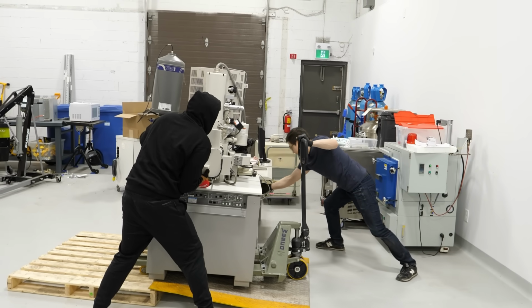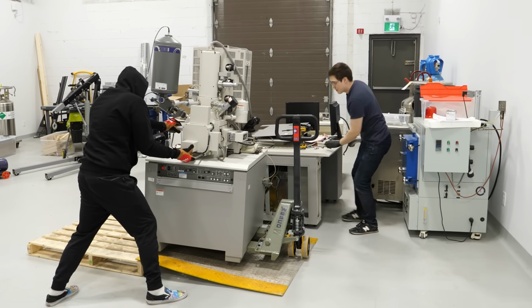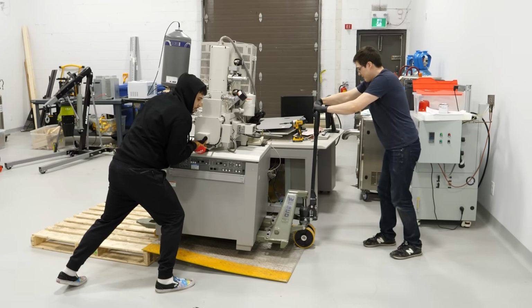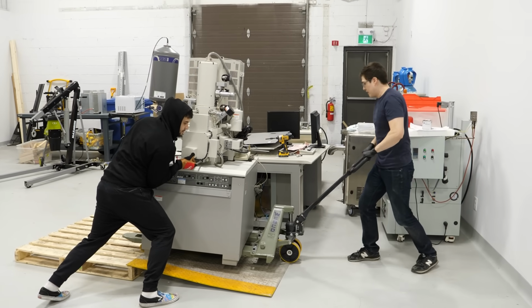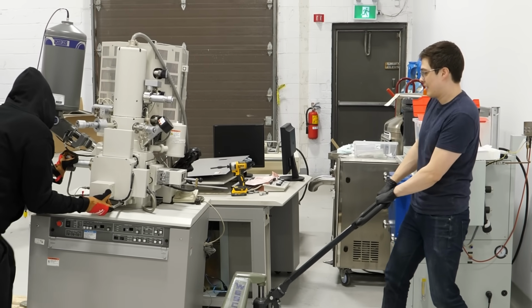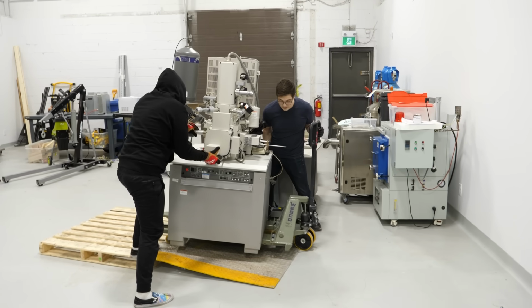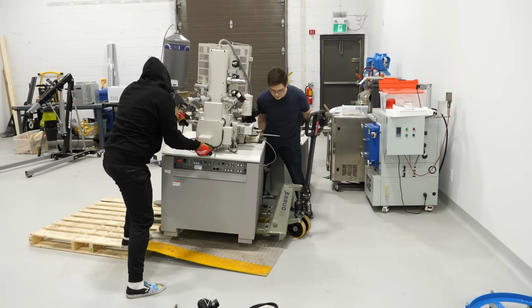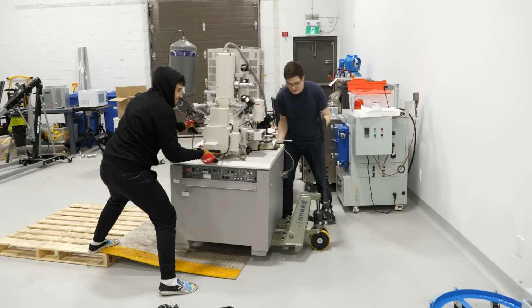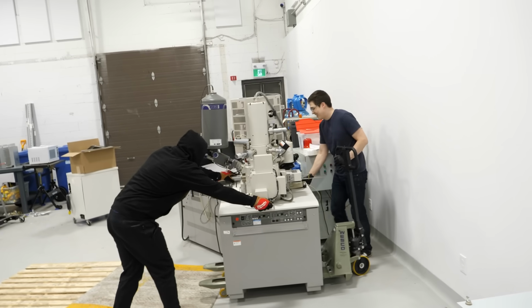No, the wire here. The umbilical cord must be protected. Go slowly. There you go. One more time. It's stuck. It's on this. See, if we tilt the weight. Oh, yeah, you're good, you're through. Hold the machine. You're good. Effortless. Woo!